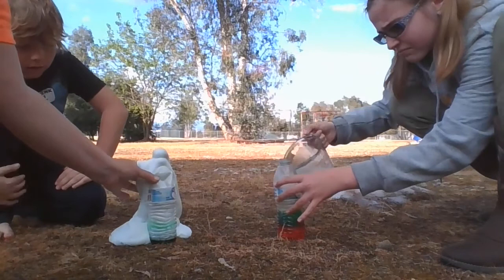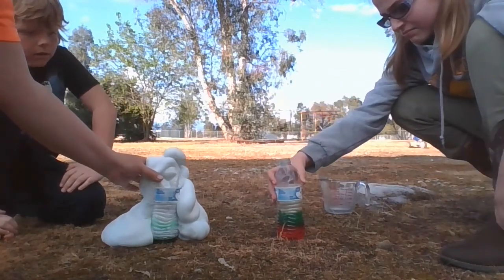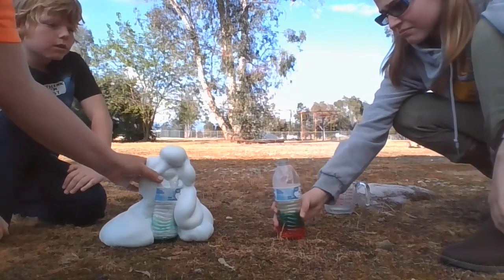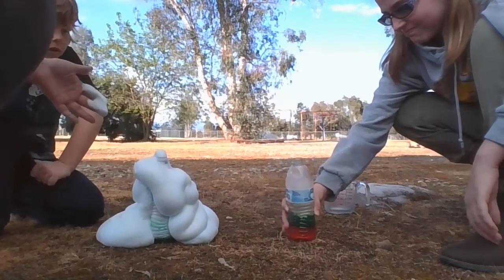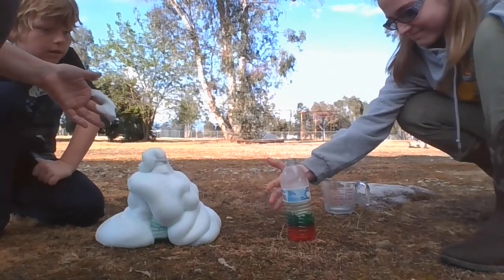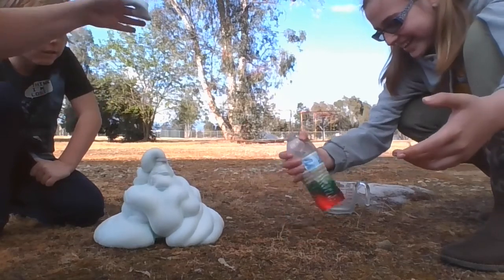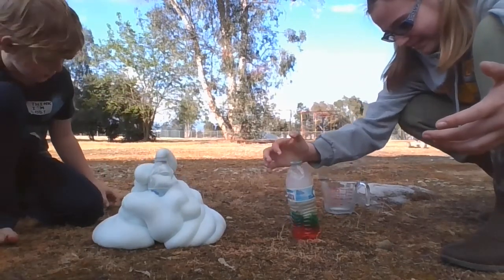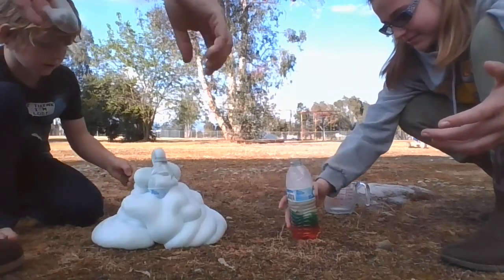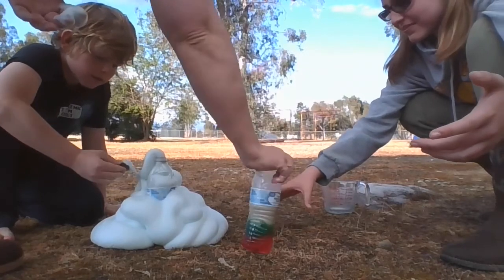Well, this one was the warm water. So they were switched. This one is the warm water that I'm actually holding. Okay, so you can see this reaction, how fast this is happening. Josie's over there. You have to wait. So you can see why we did this outside, guys, because this is elephant toothpaste. It makes a mess. Josie's really trying to get hers to start. Let's see. I think they mixed them up, but that's okay.